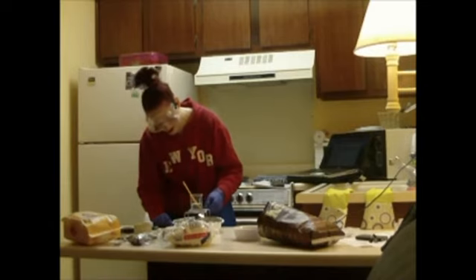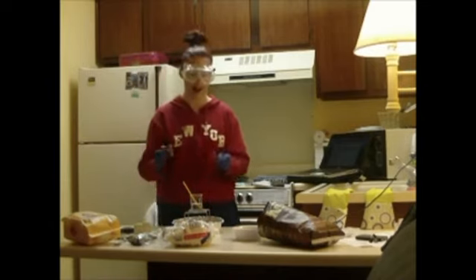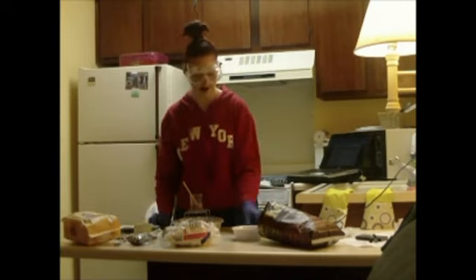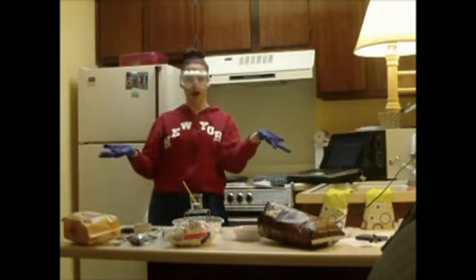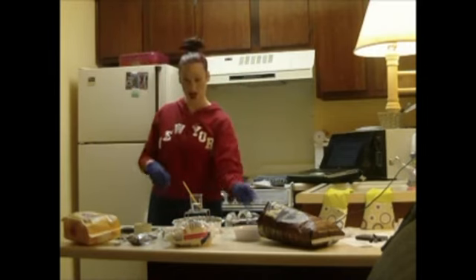Oh no. I don't think I really got a good test run on that. So what we'll do is we'll make sure we do a different marshmallow, and I'll put it more on the top here so I can truly measure the difference. So you see the process, and I'm going to get to work here.